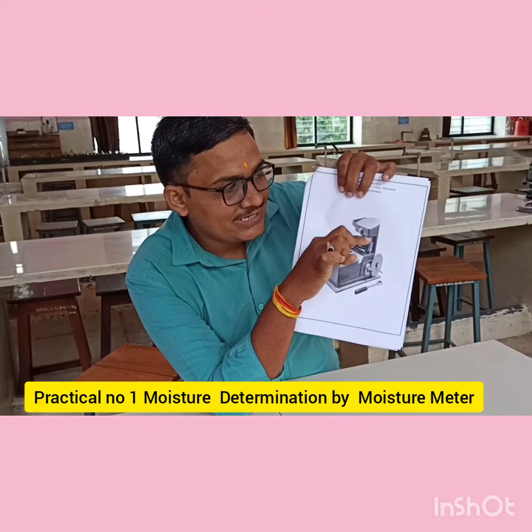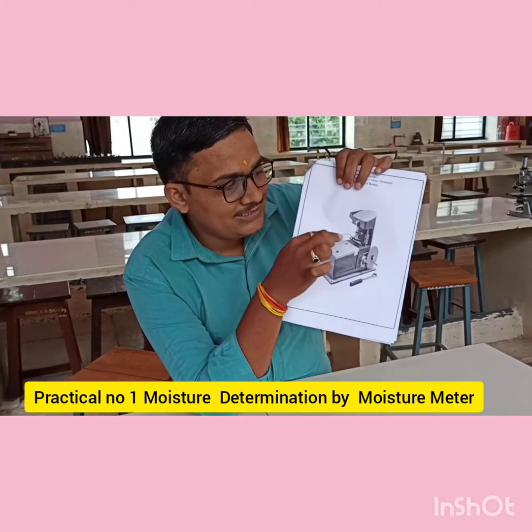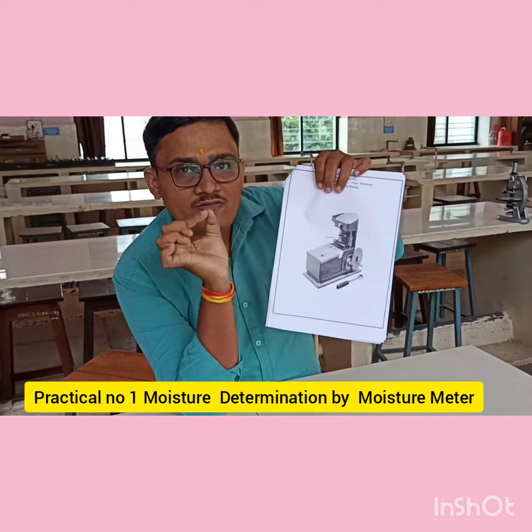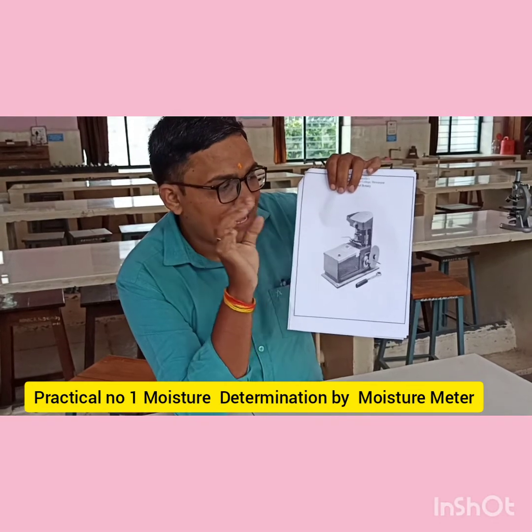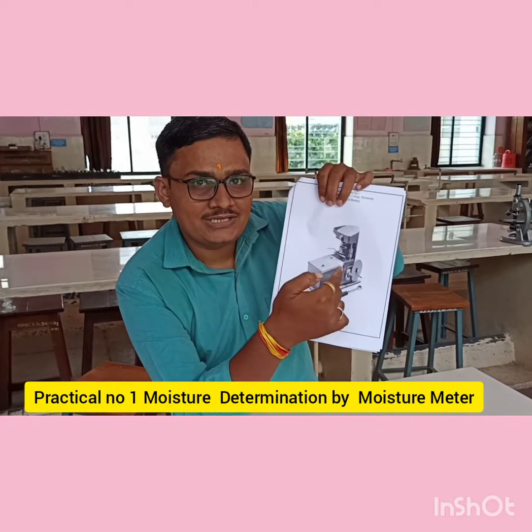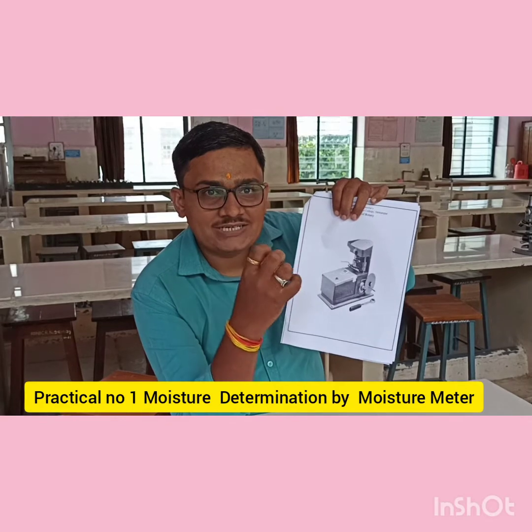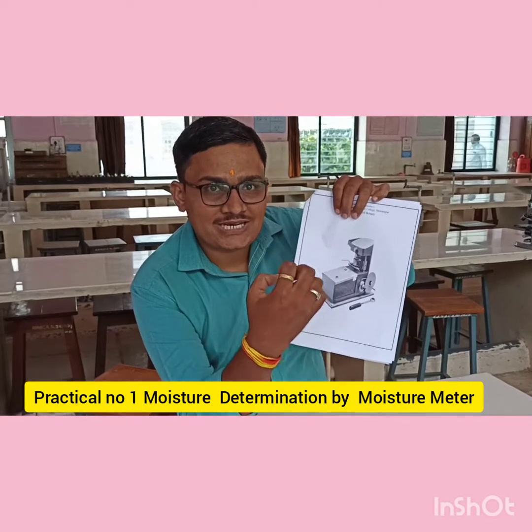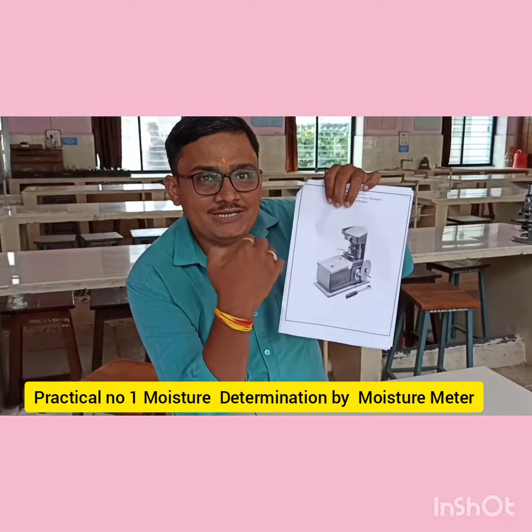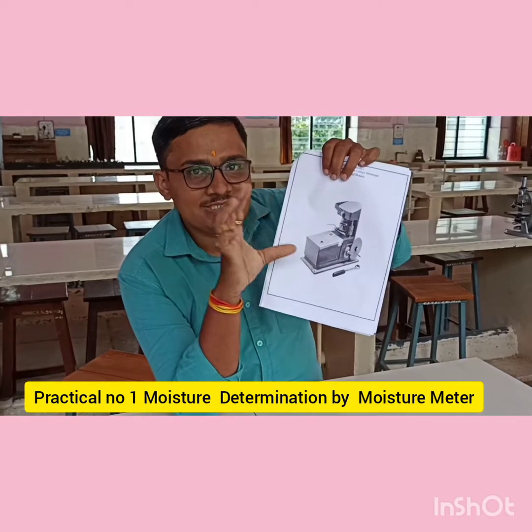The upper side part is known as the plunger. When the seed gets compressed in the test cup, we have to read the display. In the display, the moisture reading of that seed sample will be shown. The overall instrument works on the basis of electrical conductivity — that is the ability of a seed to transport electrical charge from one end to another. On that principle moisture is determined. This instrument is not available in our lab but we check it in the figure.